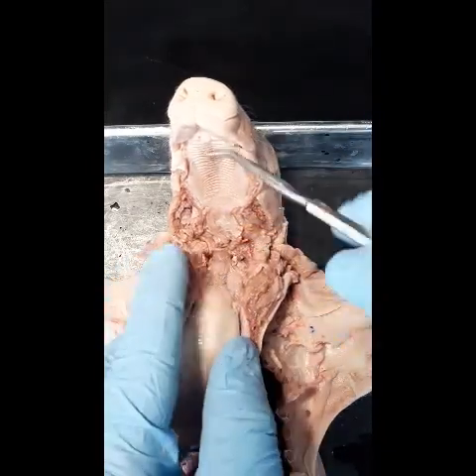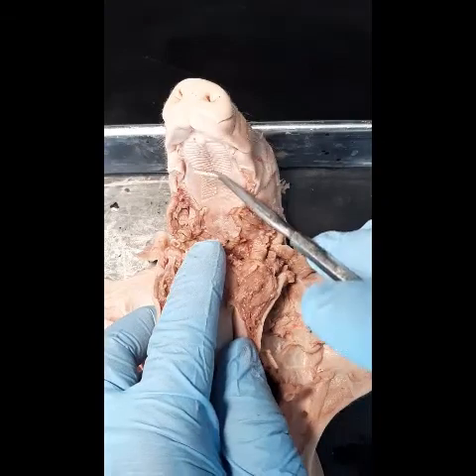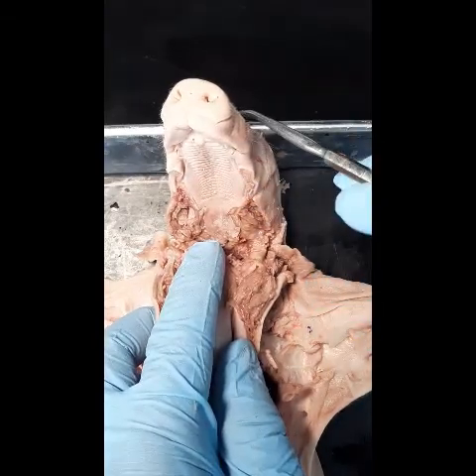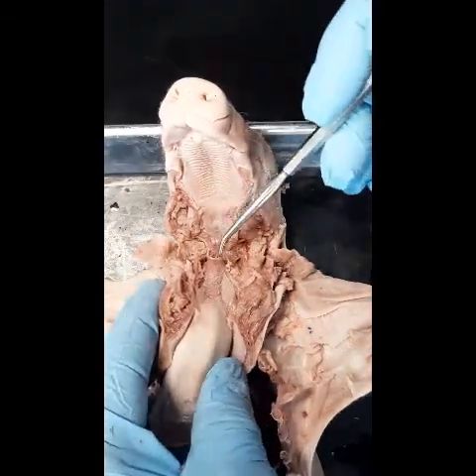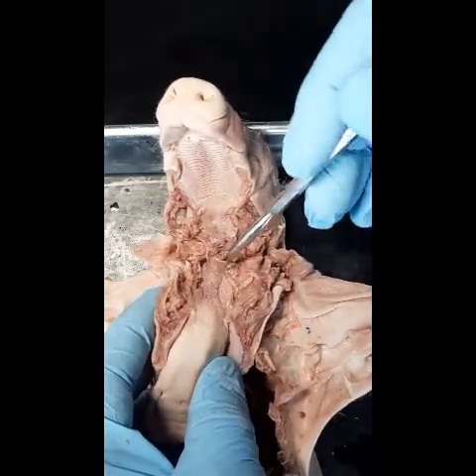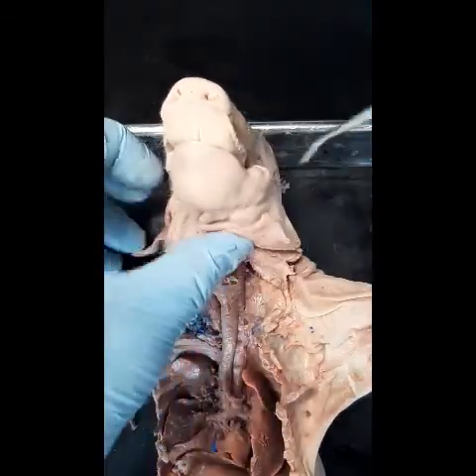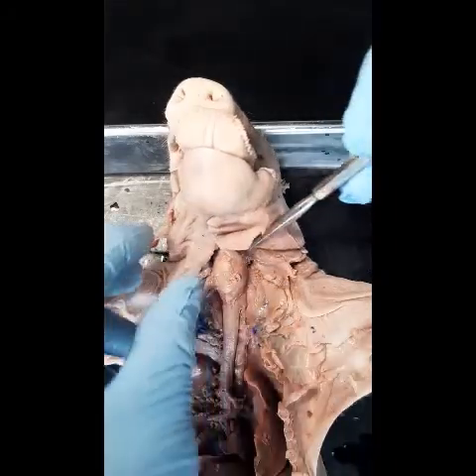We have the hard palate. The hard palate forms the floor of the nasal cavity. Here is the opening of the larynx — the glottis — and eventually you would get into the larynx.